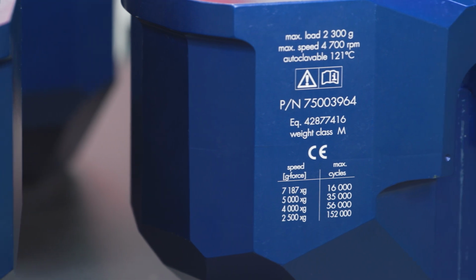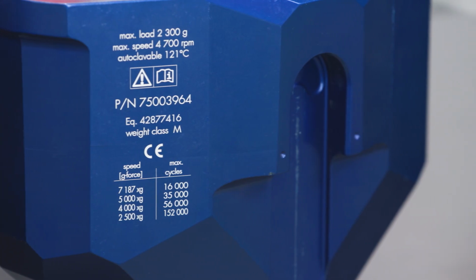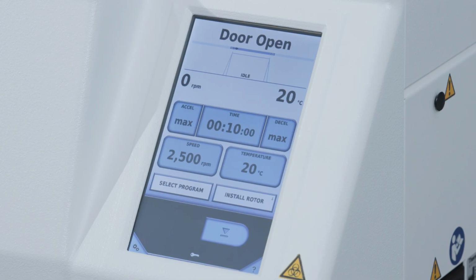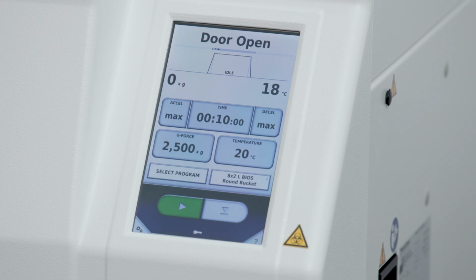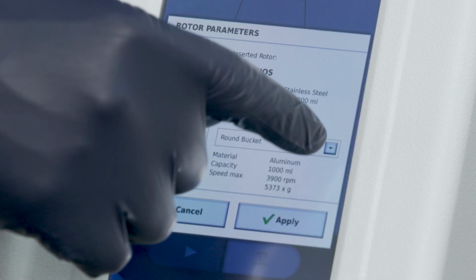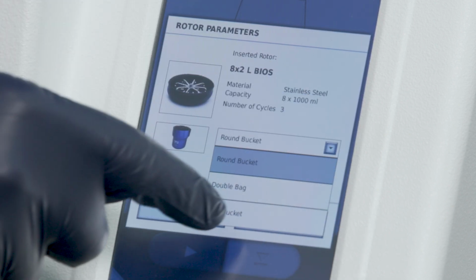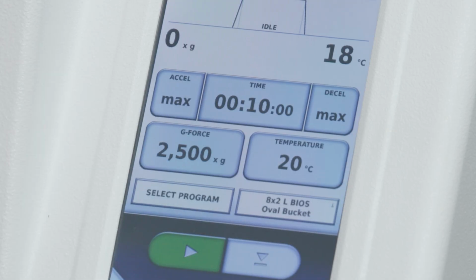The centrifuge needs to recognize the installed rotor and buckets and adjust its setting for safe and efficient operation. Go to the main menu on the touchscreen and press the Install Rotor button, or you can insert a rotor to display its information. If the Enter All Serial Numbers option is enabled, you can enter or scan the serial numbers for the rotor and buckets in the rotor window using the Set ID button. First, select the bucket type, then enter or scan the serial numbers. Finally, press the Apply button in the rotor parameters window to save the data.